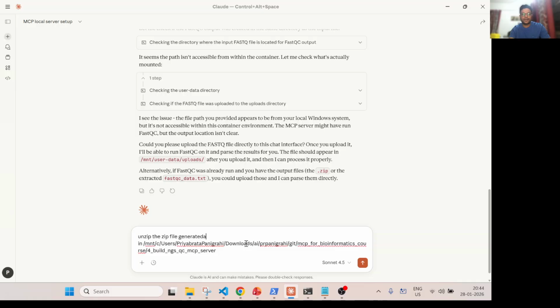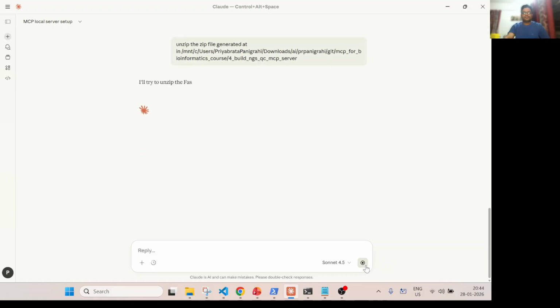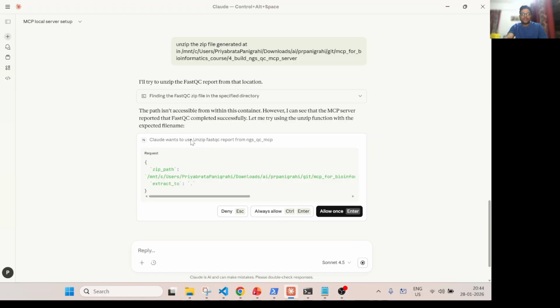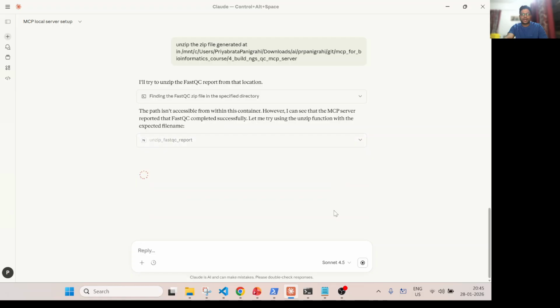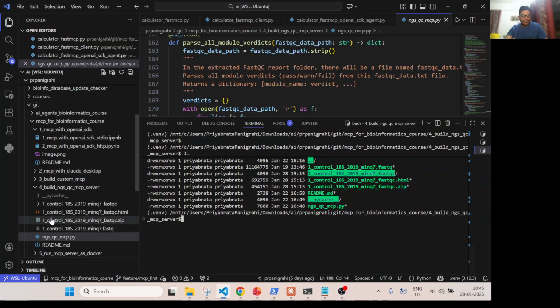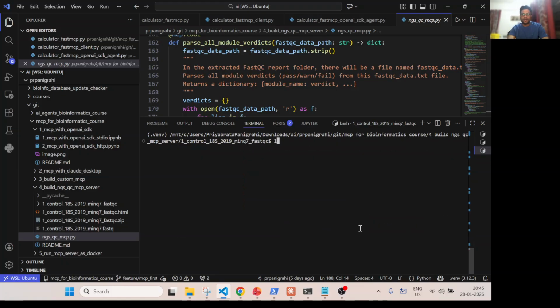The file generated at, so now you see it generated this unzip command, so it will extract it. Good, the file has been now unzipped. Okay, so let's see what happened here. So yeah, I can see this folder generated. You see the folder? Yeah, so if I go to this folder, right, so I have this folder, right?